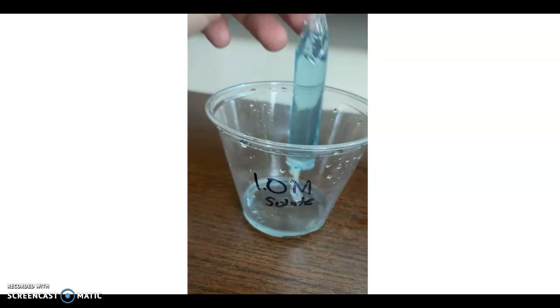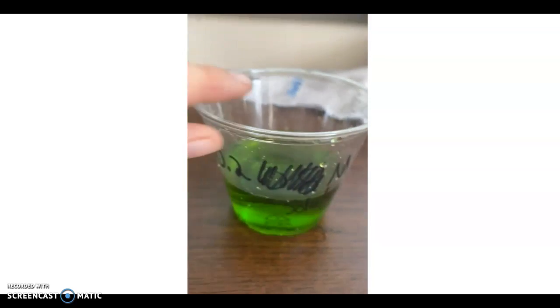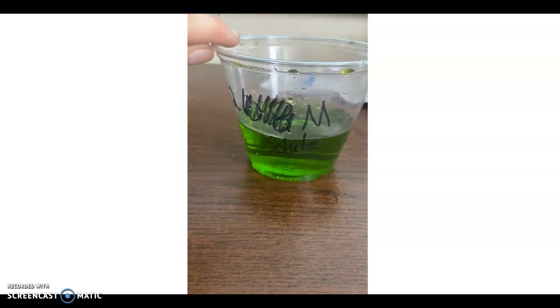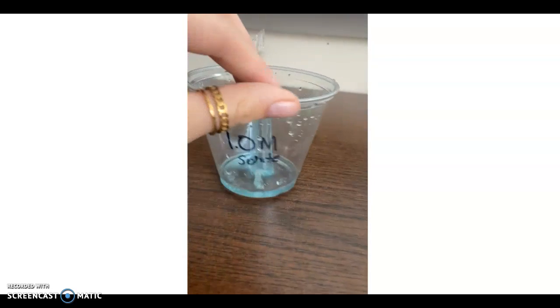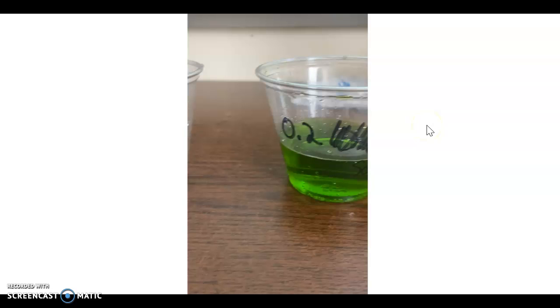The hypothesis students were making was basically focusing on, again, the tonicities of the solutions inside and outside the bag and their prediction on where water was going to go based on those tonicities. So you can go ahead and fill out the hypothesis section on the second page of your lab handout before proceeding to the actual lab execution.